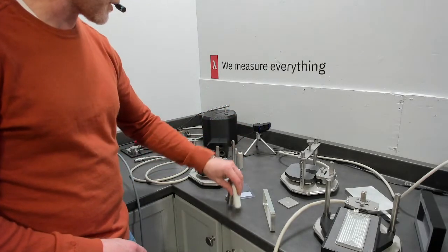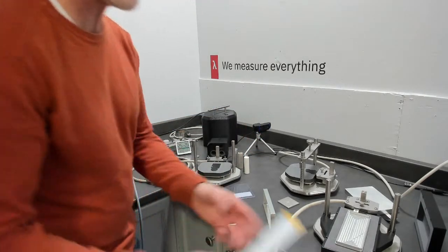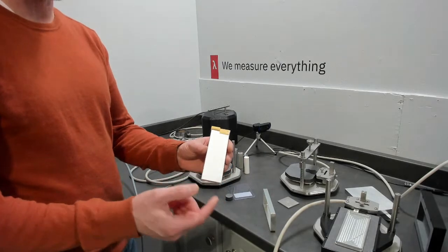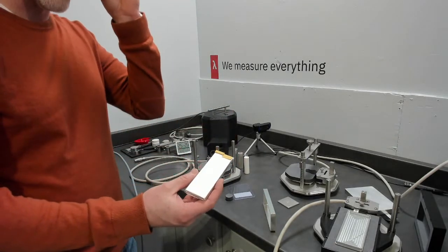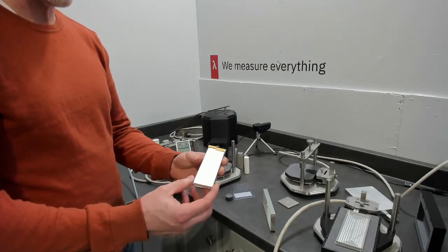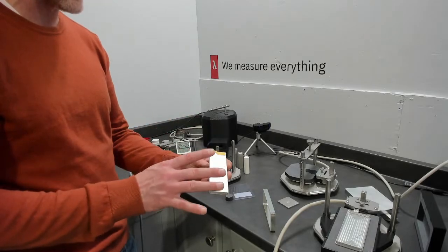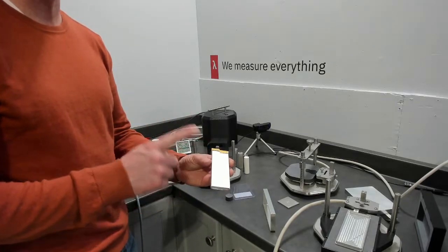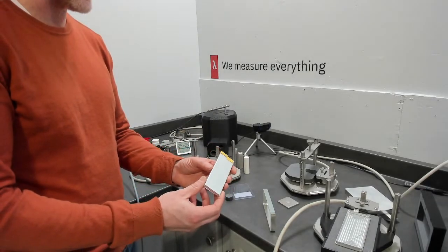But we're going to show a little setup for, once you have your specific heat on your pouch, how can I make a measurement for anisotropy? So using the Transient Plane Source method, following the ISO, we can do a surface sensor, or TPS sensor, in contact with this. We're going to do an asymmetric measurement, single-sided, and then we'll go to the software and show you how that measurement is done in the software.